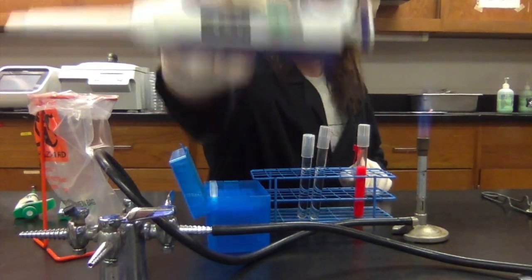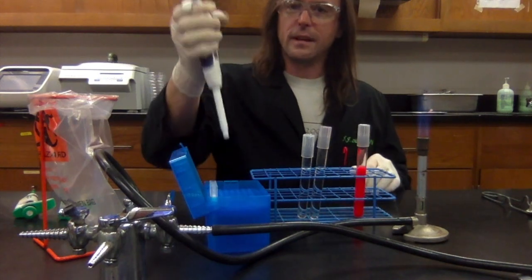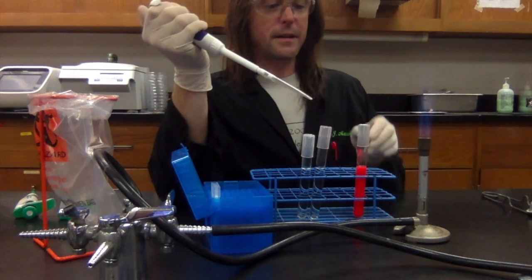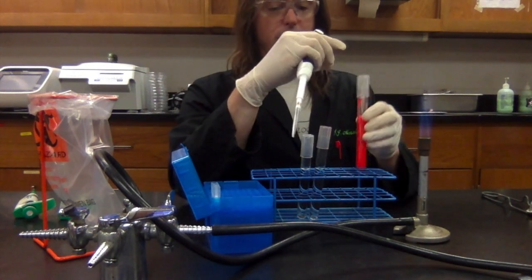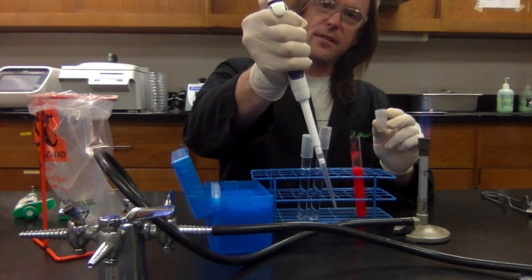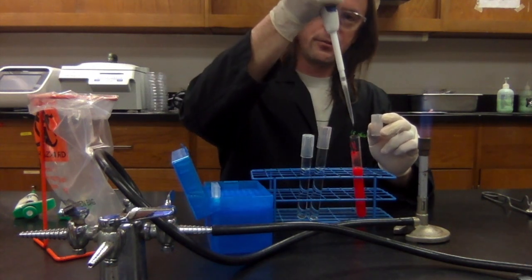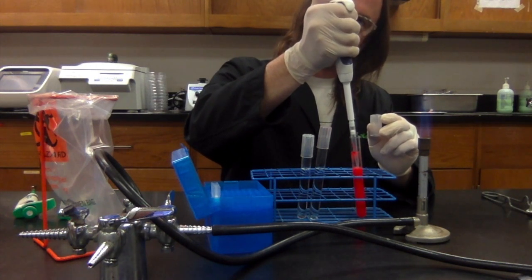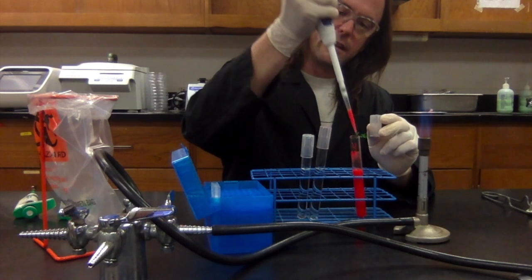So the first thing I do is I set my pipetter to 500 microliters. Okay, now I'm going to get a sterile pipette tip on the end of the pipetter. Okay, I'm briefly going to pass the first tube through the flame. All right, and now what I'm going to do, I'm going to push down on the plunger. I'm going to do that before I put the pipette into the tube. And I'm going to insert this until the tip is just beneath the level of the liquid. And I'm slowly going to release this plunger, which is going to pull the liquid up into the pipette tip.